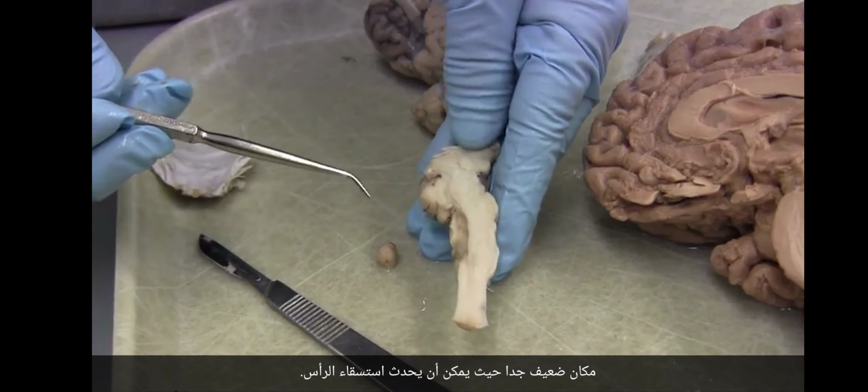Okay, so in the next section, we're going to look at all the ventricles.